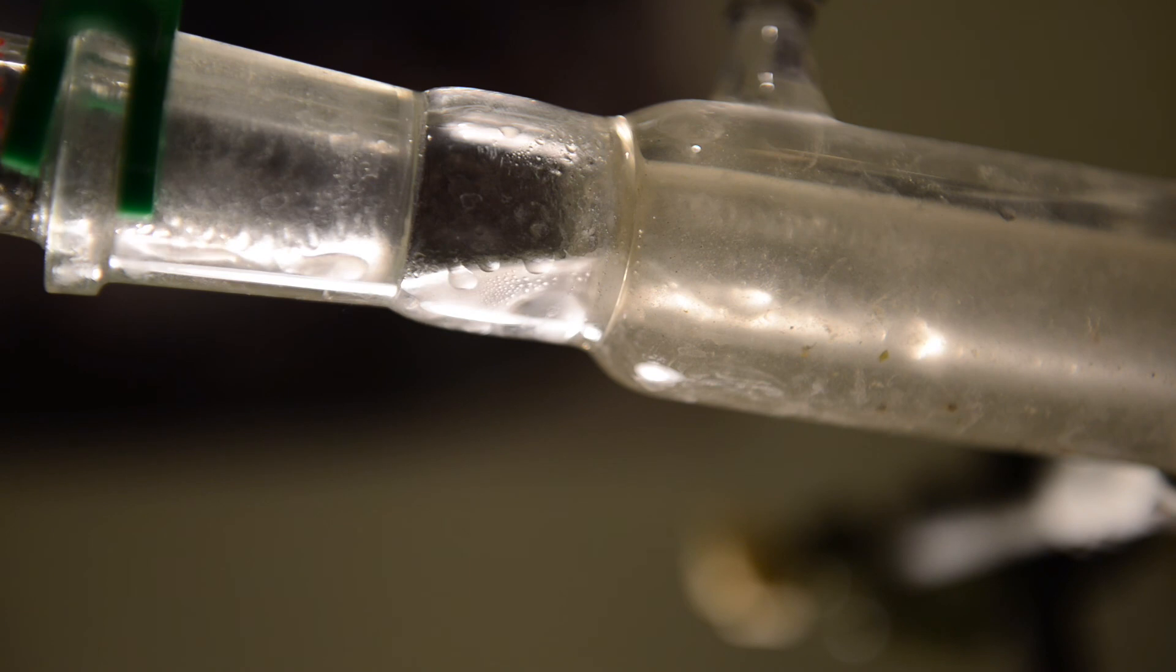You will see in the next part of this video, how we dry and fractionally distill the crude allyl bromide and what is our total yield.